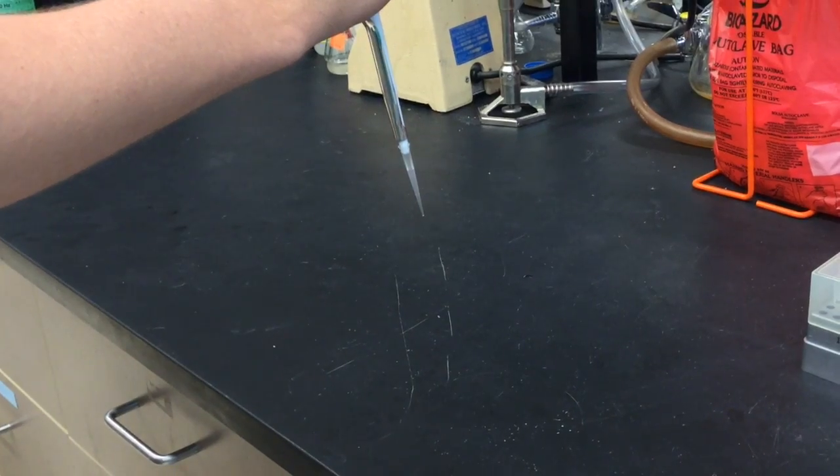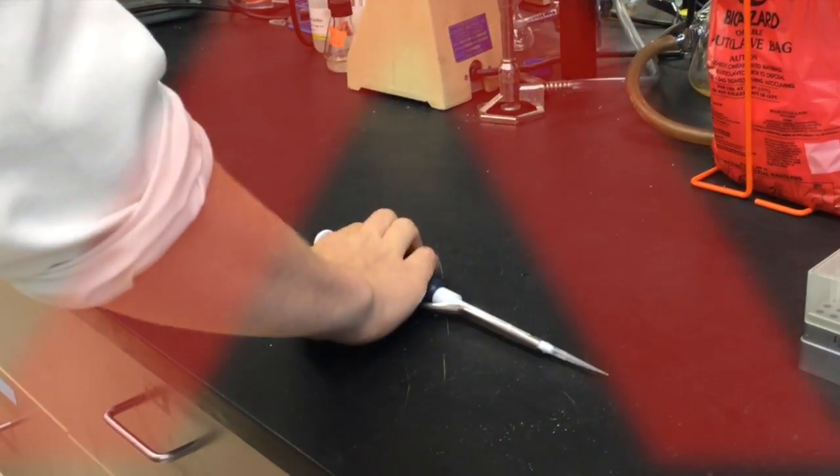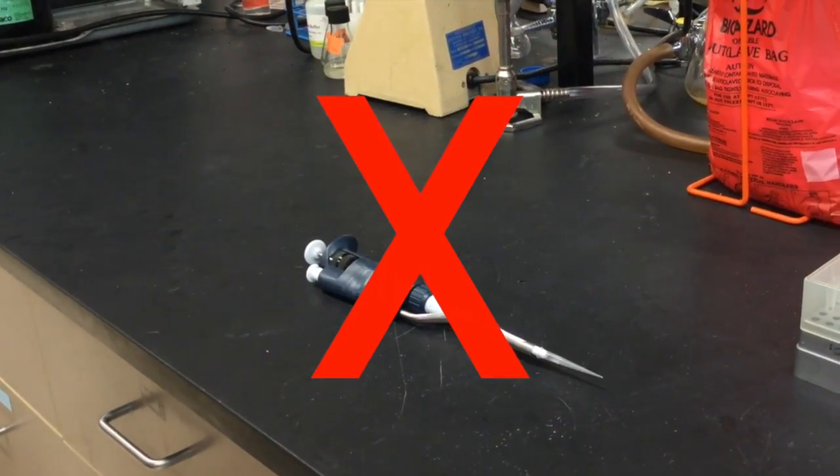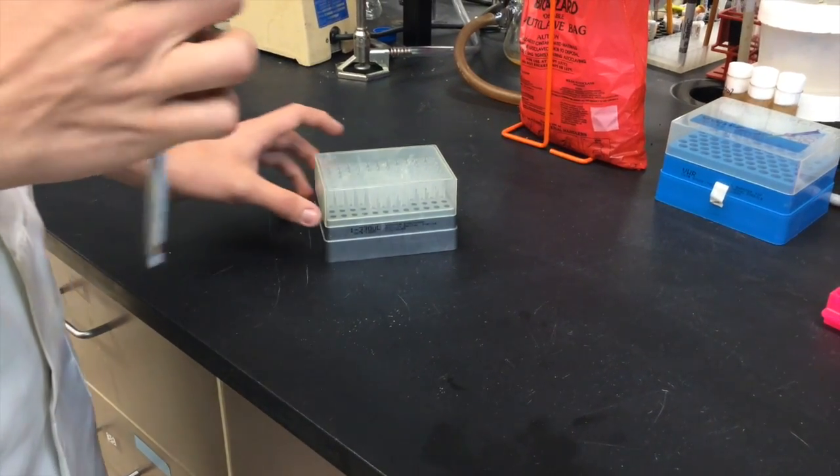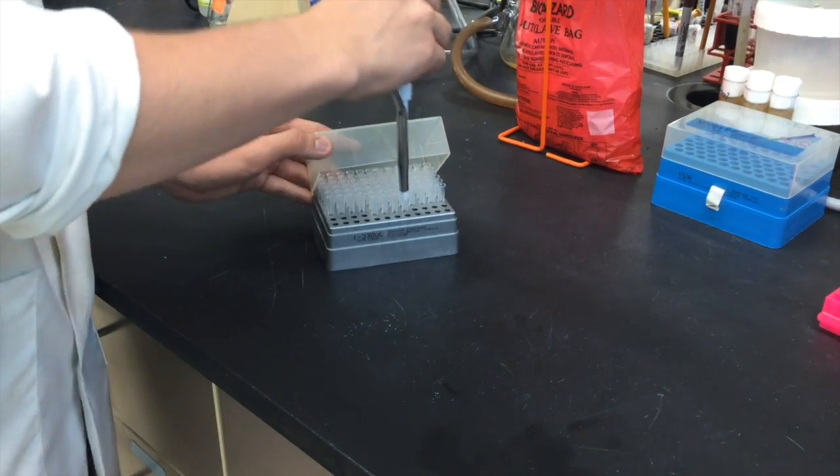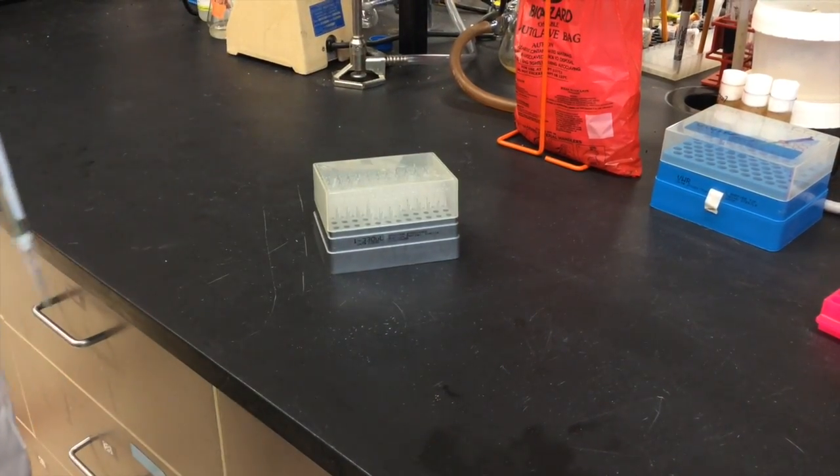Never place a pipetter with the tip attached down on the workbench. Keep the pipetter in your hand at all times after you have attached the tip. The box of tips should never be left open. Make sure to close the box after you remove a tip to prevent airborne contamination.